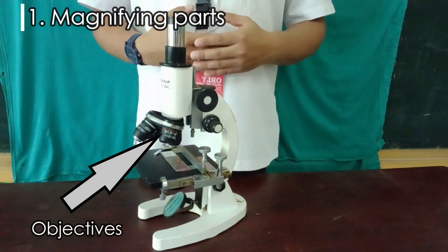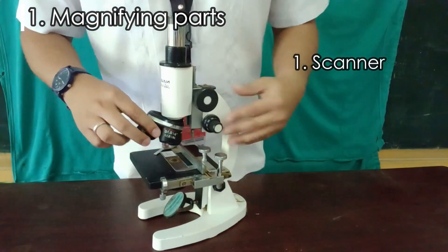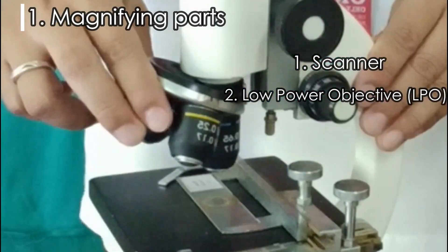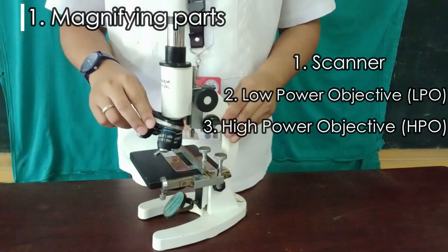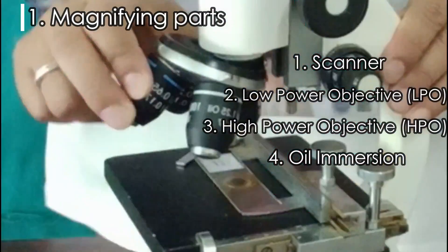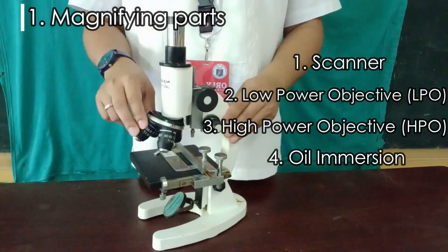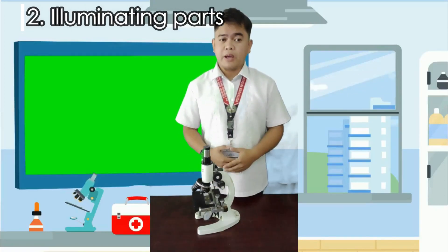There are four objectives in our compound microscope: the scanner, which has the lowest magnification; low power objective or LPO; high power objective or HPO; and oil immersion, which uses a special type of oil to magnify our specimen.